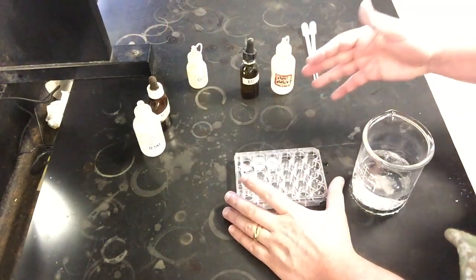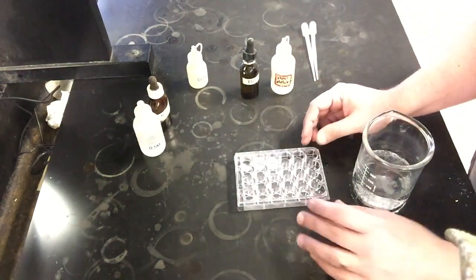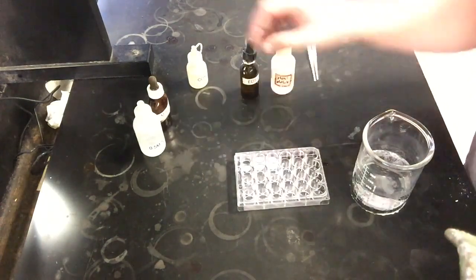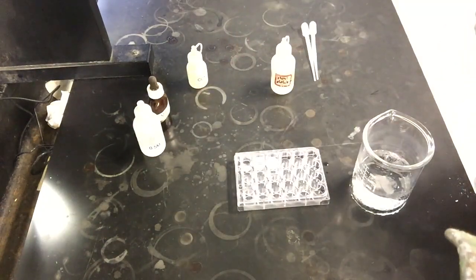So adding HCl is doing something in our reaction to get rid of the solid, and I'm going to leave the rest to you guys to look at and make your correct observations and conclusions from. And the other change you want to look at in the second well is by adding EDTA. So I'm going to add some EDTA to the second well.